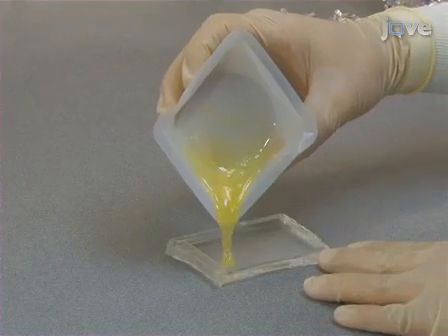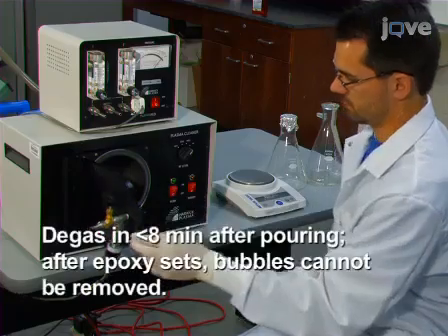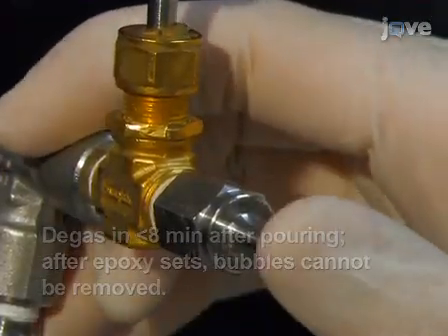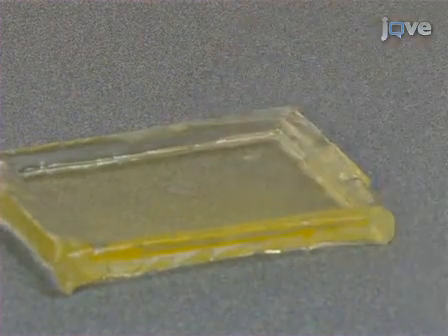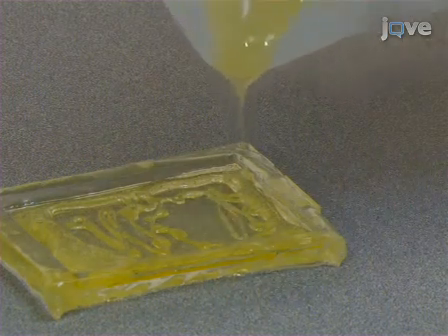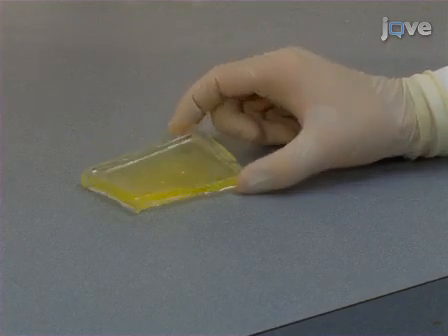Next, pour a thin layer of 6 grams of 2-part epoxy that has just been mixed for 1 minute into the master mold. Degas the epoxy immediately, using many bubble-breaking cycles before the epoxy sets. After the degassed epoxy has been allowed to sit undisturbed for an hour, it will be partially cured. Add more epoxy to the mold without degassing to produce a thicker structure that will be easier to handle in later steps. Then, allow the epoxy to cure for 1 to 2 days.